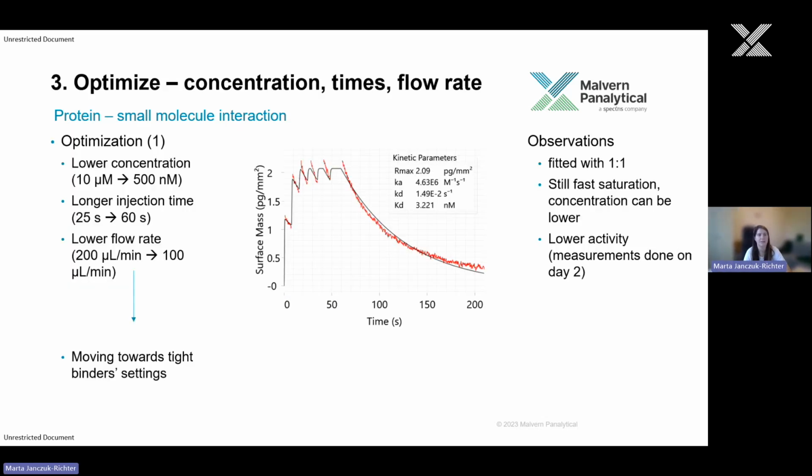Okay, let's optimize. I decided to lower the concentration a lot, but at the same time, I gave it a little bit more time. So I'm moving from intermediate binder settings towards tight binder settings, where we have longer time but lower concentration. And it already looks good. We are still saturating quite quickly, so maybe there is an even lower concentration that can be used. But now we can see that it is much better fitted with the one-to-one model. So maybe we can give it one more step with waveRAPID.